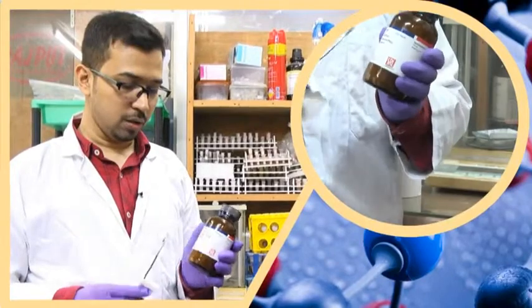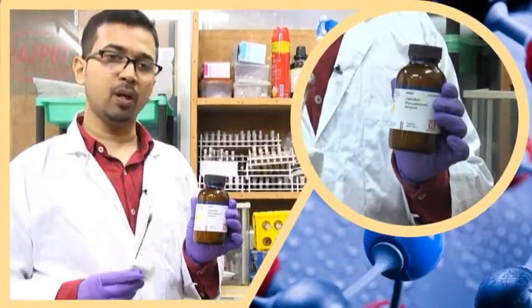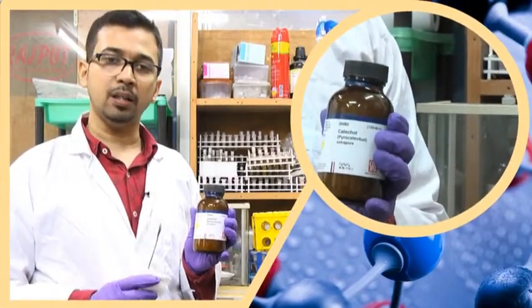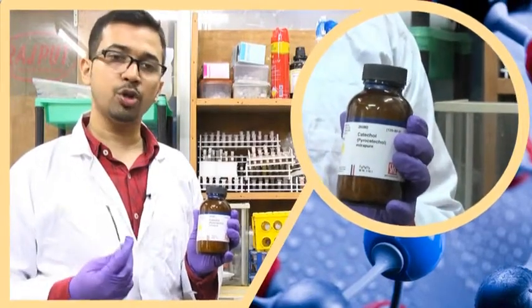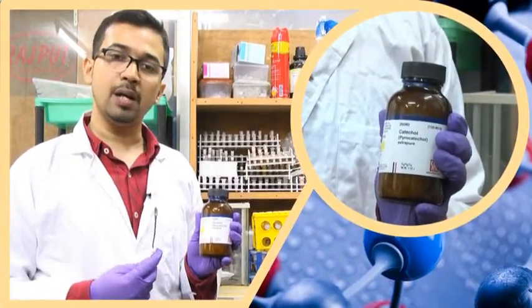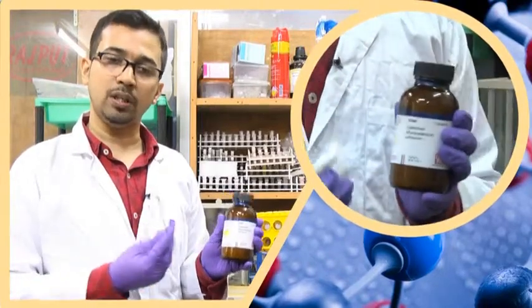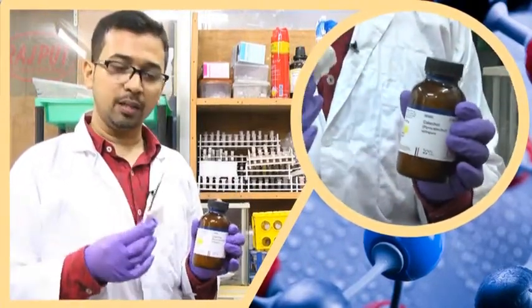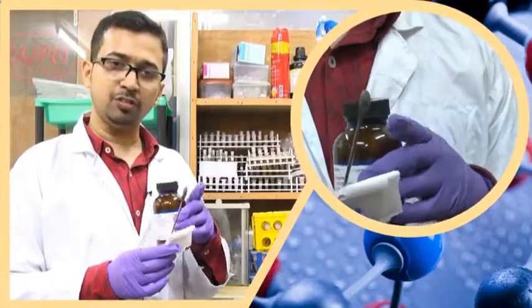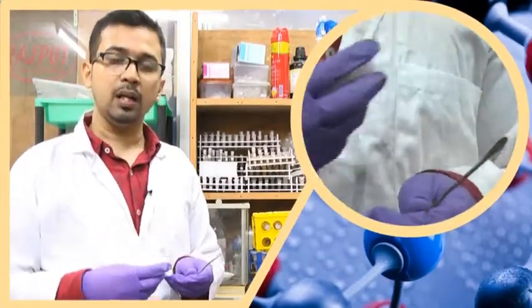The substrate we are going to use is catechol. Here is a 100-gram bottle of catechol. We are going to prepare 20 millimolar, 50 ml catechol in phosphate buffer at pH 7.4. Keep in mind that all solutions in this reaction are prepared in phosphate buffer at pH 7.4. The strength of the phosphate buffer can be varied from 10 to 20 or 25 millimolar. All physiological processes are generally done within this concentration range. We are cleaning the spatula with a tissue paper and now taking the catechol. For 20 millimolar, 50 ml catechol solution, we require 0.11 grams of catechol.